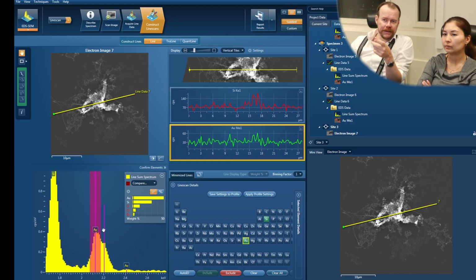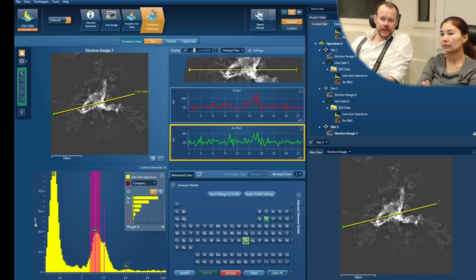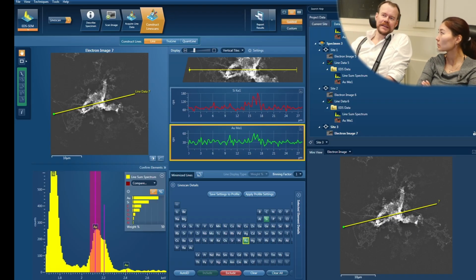In the spectra, we see that there are counts, but here perhaps we can have units counts. So now we have 200 counts there on the gold. So we do detect gold there, but we cannot measure some lateral resolution here. But in the STEM, it worked perfectly fine. We actually made some trace there. Yeah, so that's very nice. So that was a good sort of flashback in comparison to that.